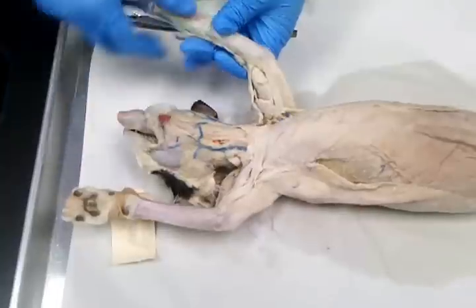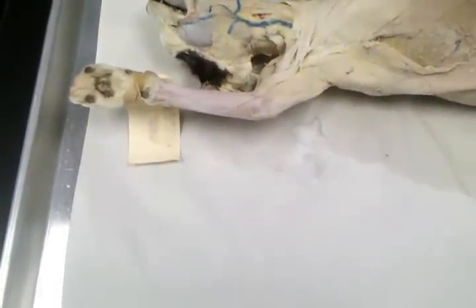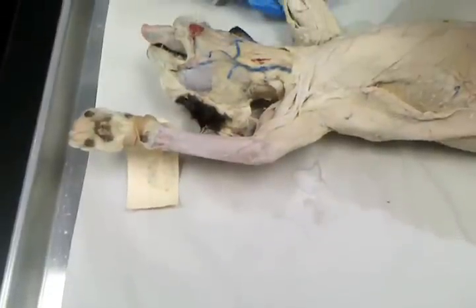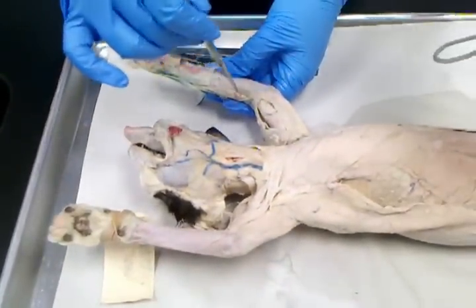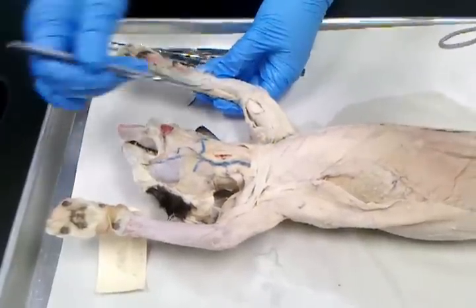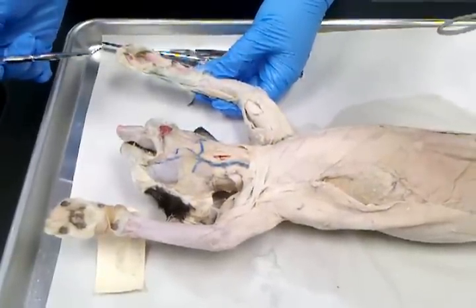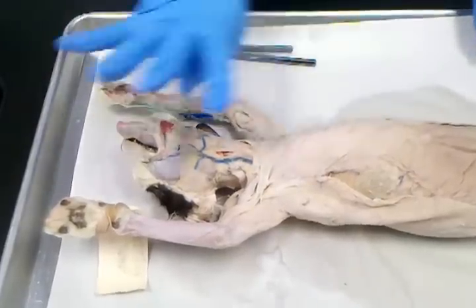So in the lower part of the forelimb, you've got brachioradialis, okay? And to your advantage, it's the only lower arm muscle you have to know. So if something's pinned down here, you know it's brachioradialis, okay? All right, so that was the arm.